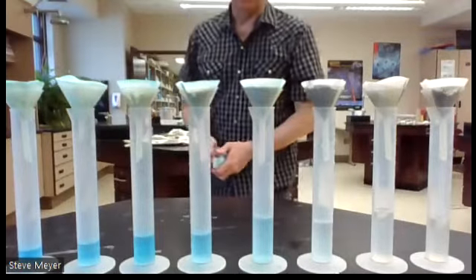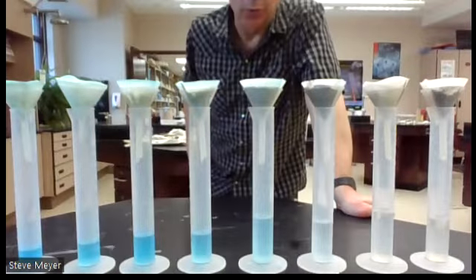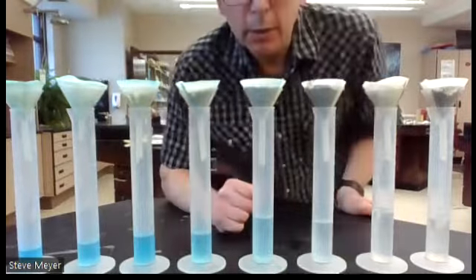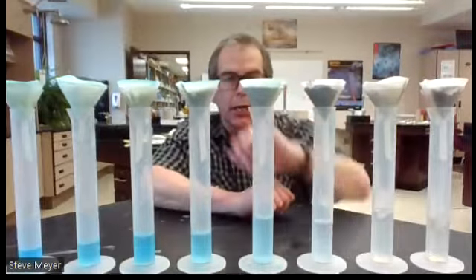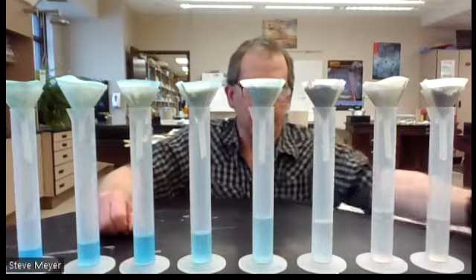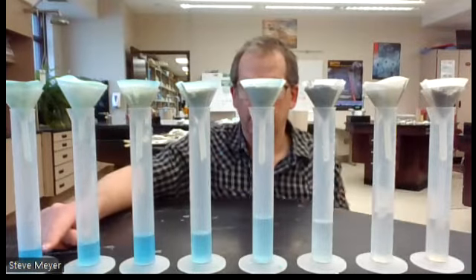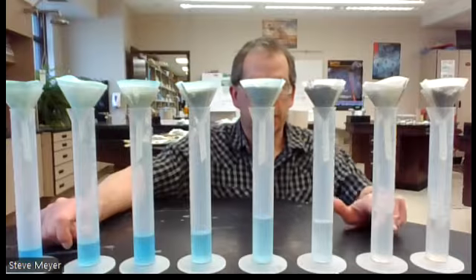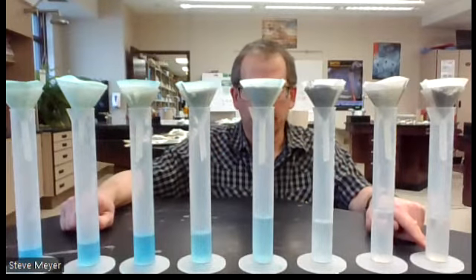These are the results for the precipitate lab, just a visual. So after day 2, we filtered. There's a filter paper with a funnel, and we collected our precipitate or solid here, and this is what dripped through. This is lined up with test tube 1 over here, and then test tube 8 over here. And you can see test tube 1 looks very clear.